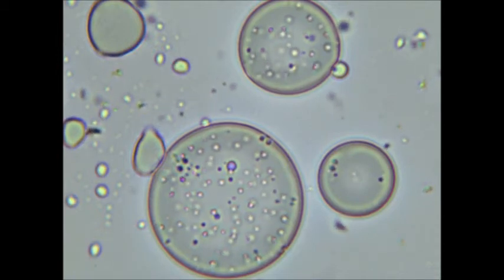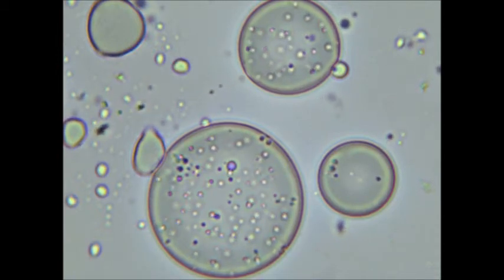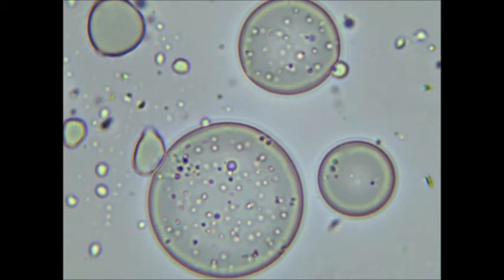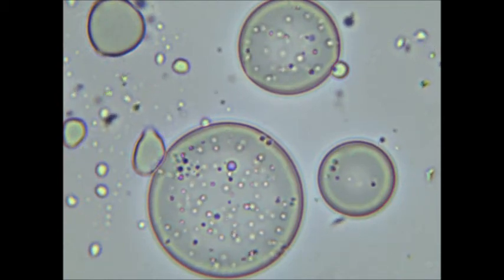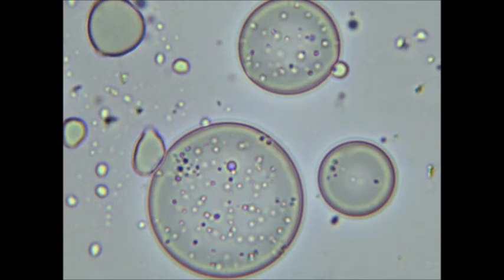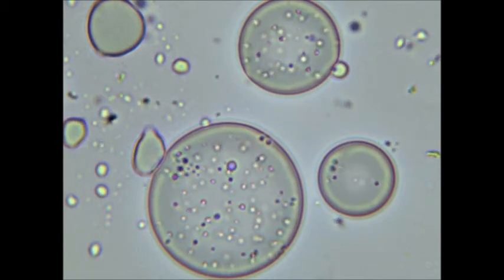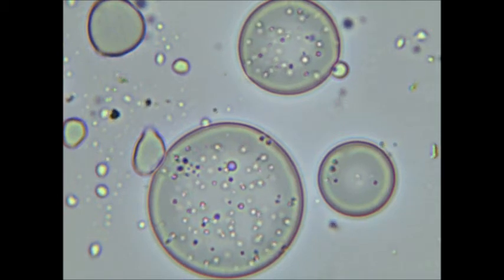I first took some olive oil and separated it into glycerol and fatty acids by a base hydrolysis using sodium hydroxide. I then took the resulting fatty acid layer and mixed a small portion of it with distilled water.